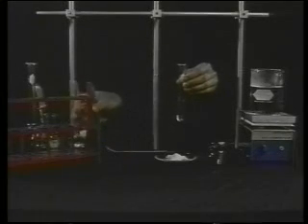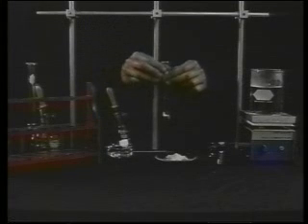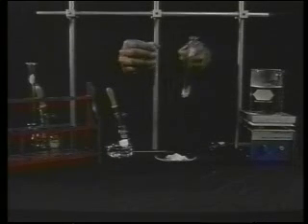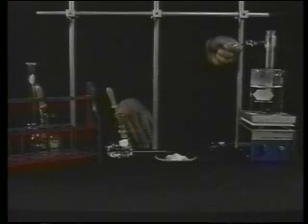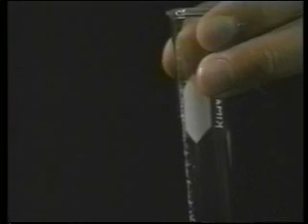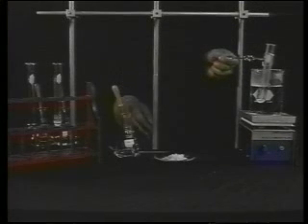Repeat with another test solvent. Place a small amount of solid in a clean test tube, then add about one milliliter of the different test solvent. If the solid does not dissolve, place the test tube in a hot water bath with a temperature at the boiling point of the test solvent. If the solid remains, then this solvent also is not suitable. Repeat this process once more with another solvent. If the solid remains at room temperature but dissolves in the hot solvent, then finally, this solvent is a suitable recrystallization solvent.